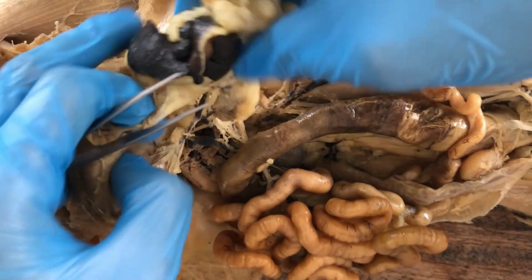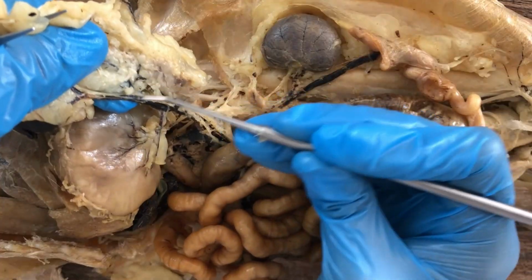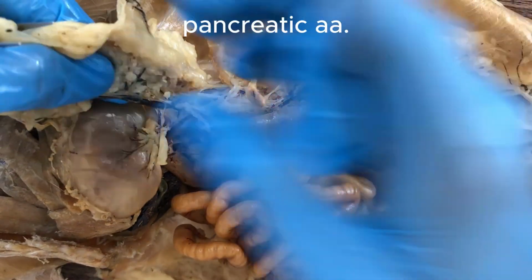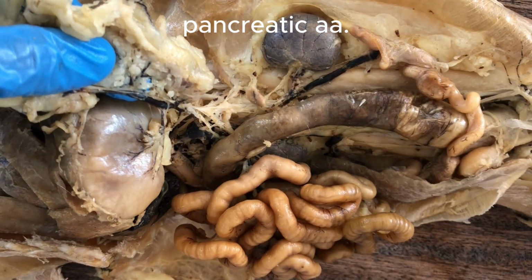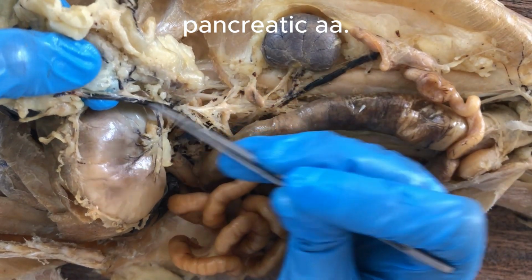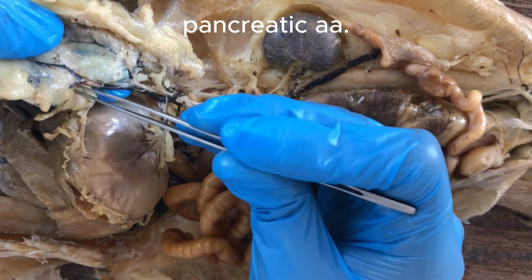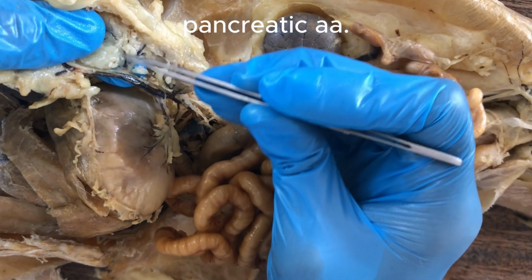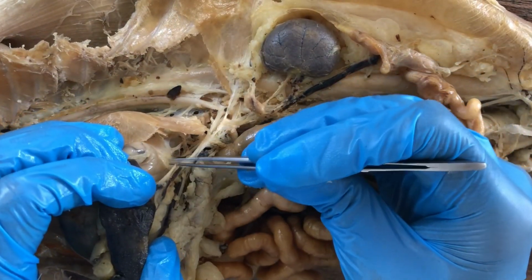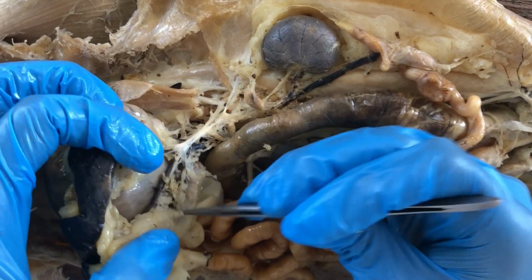And the splenic artery also gives rise to pancreatic arteries, along with the pancreatic veins. So anterior splenic, posterior splenic, and then pancreatic arteries.